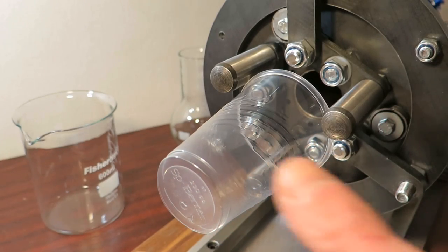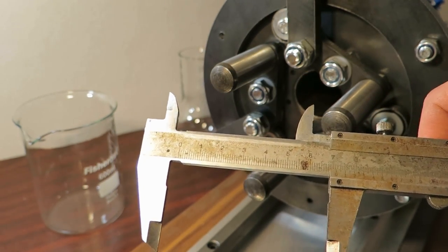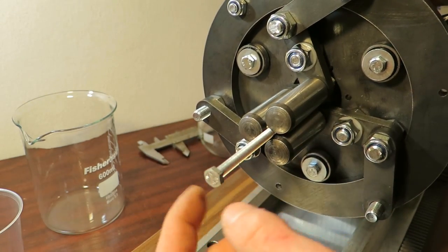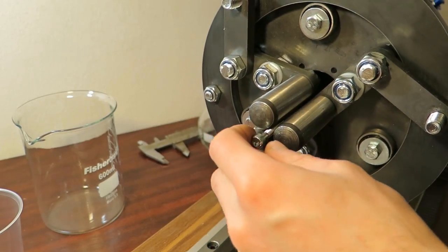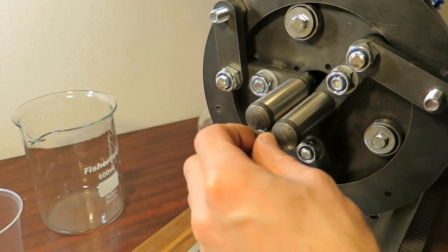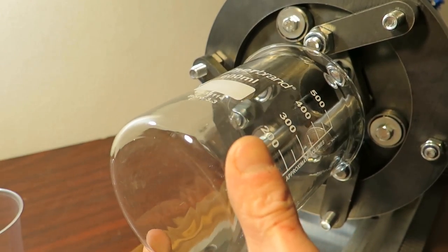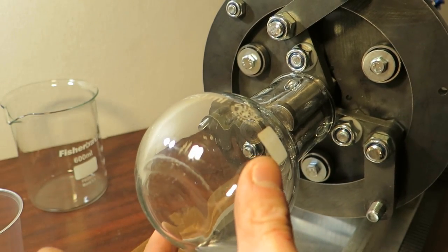Oh yeah, this is about the size. And that is 70 millimeters diameter. Minimum diameter on the other side is about 8 millimeters, I think. Well, this is a 6 millimeter bolt, and I can hold it there. And what about 5 millimeter? Yep. This is 4 millimeters, I believe. And this nail here is 2.9 millimeters. And nope. From the inside you can probably hold whatever you want, maybe even this beaker, if it wasn't crooked, of course. What about this thing? Can I? Oh yes, I can. But it is also a little bit crooked.